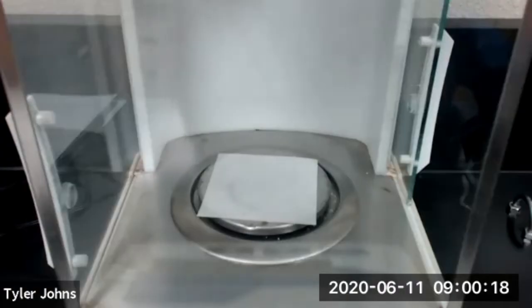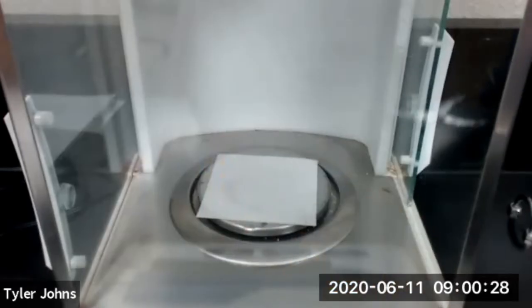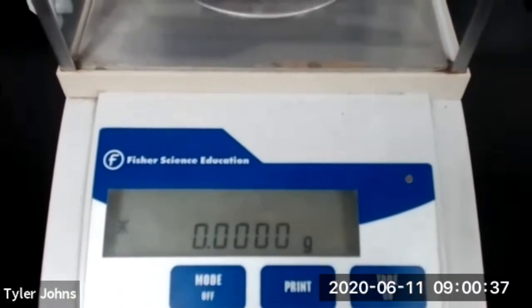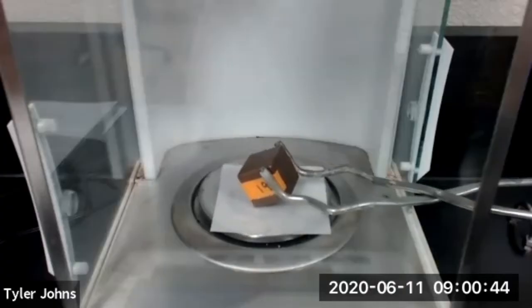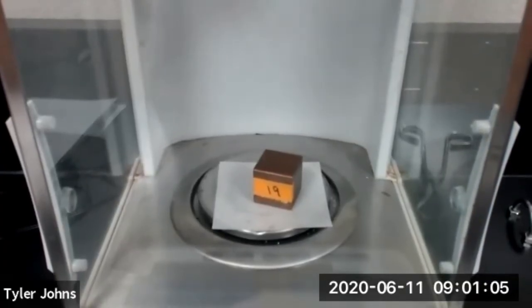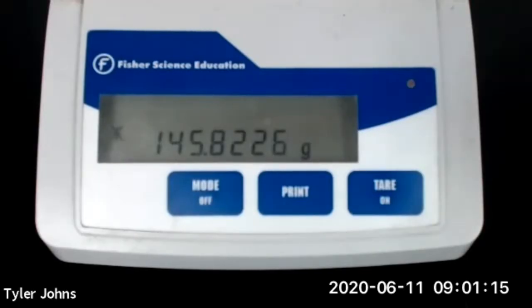We're now going to determine the mass of object number two, the copper cube, using the analytical balance. We've already placed our weigh paper on the balance and tared it, so we'll add the copper cube. The mass of object number two, the copper cube, is 145.8226 grams.